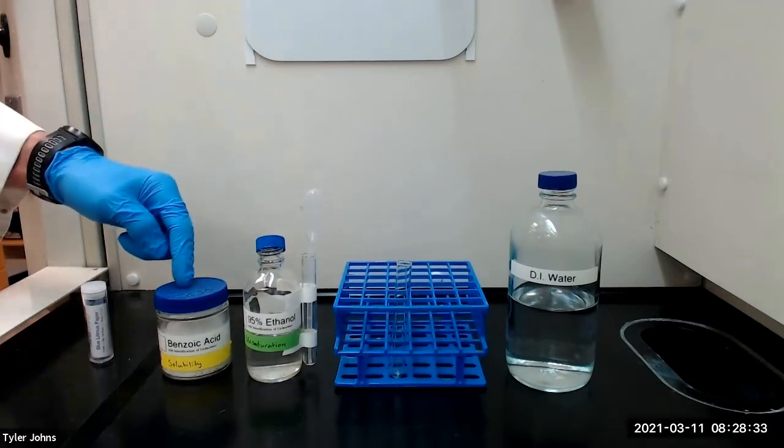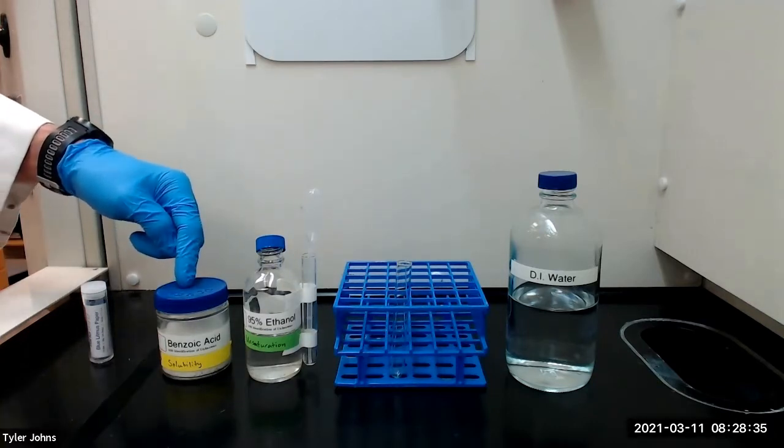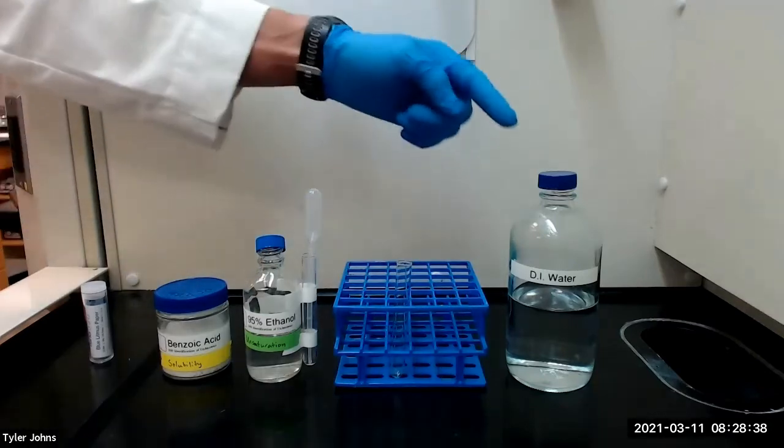The test compound that we will be using is benzoic acid. Compounds that are insoluble in water can be dissolved in ethanol and water.